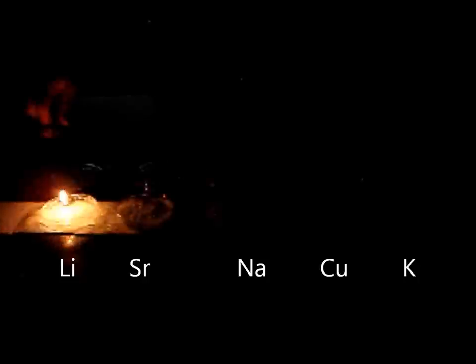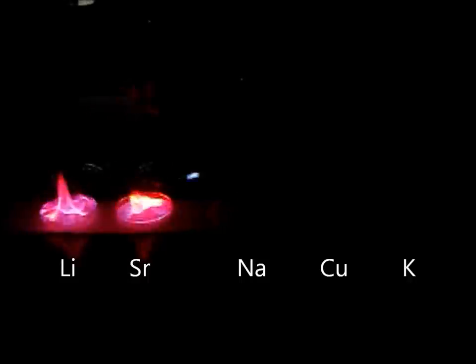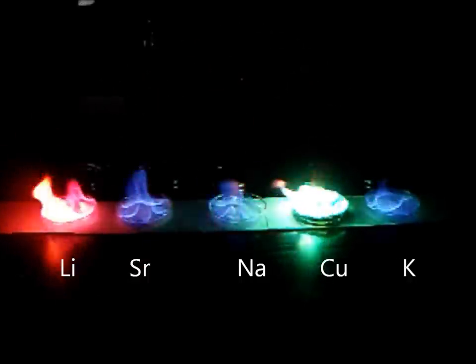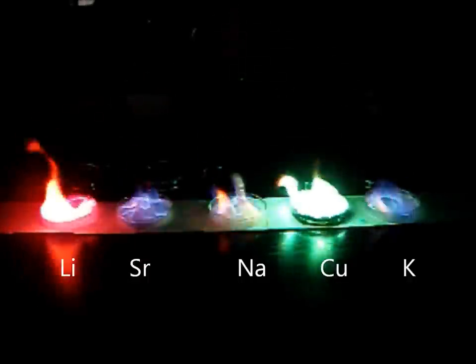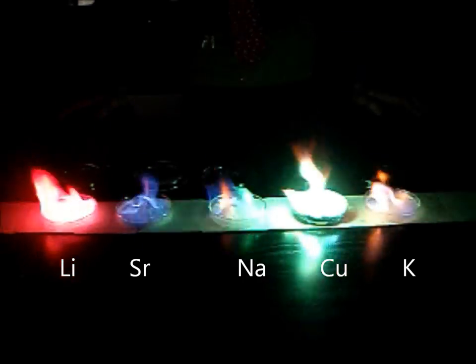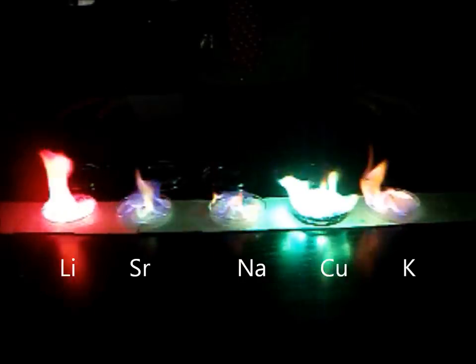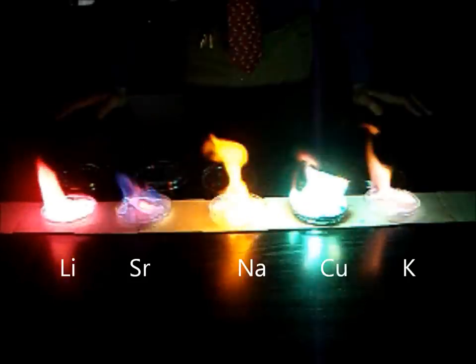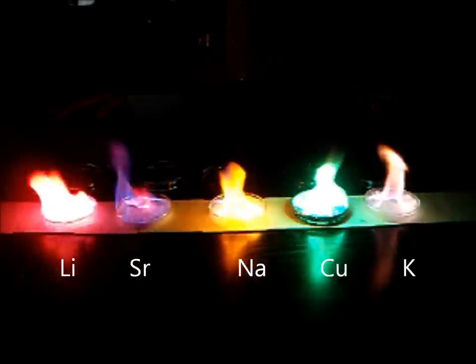This is a flame test. Now, the blue color that you're seeing immediately is going to be methanol burning. As the salt dissolves, you should see the various metals glowing their appropriate colors.